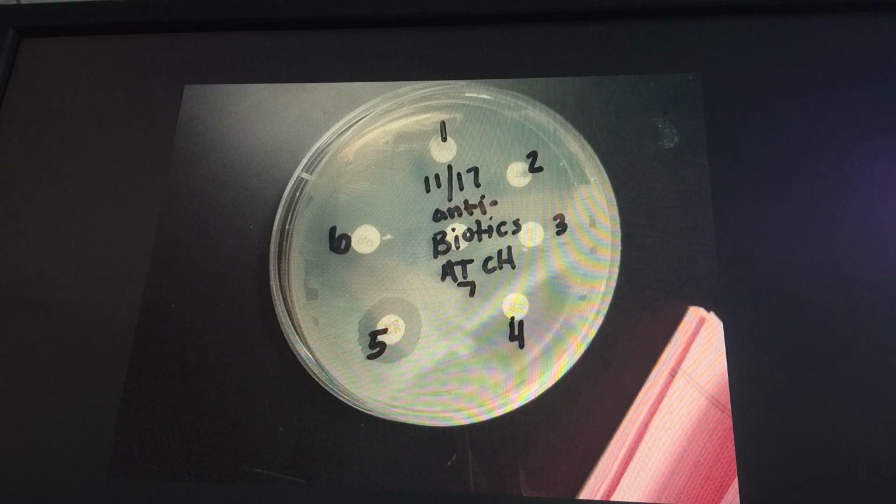Lastly, number 1 shows E. coli and its sensitivity to ciprofloxacin. The zone of inhibition was 40 millimeters, meaning it was able to kill E. coli up to that point. Ciprofloxacin falls into the category of a quinolone antibiotic. At the molecular level, the ciprofloxacin interferes in the enzymatic process of gyrase that causes DNA to unwind. This stops the synthesis of DNA and protein synthesis. As a result, the growth of bacterial colonies is stopped. I would use ciprofloxacin to treat an E. coli infection.